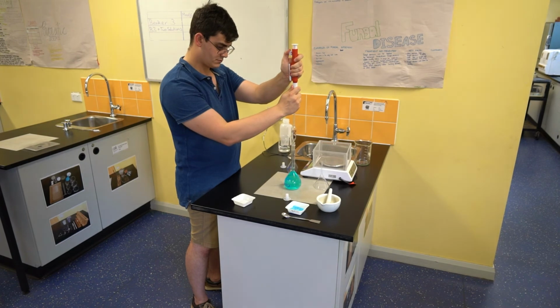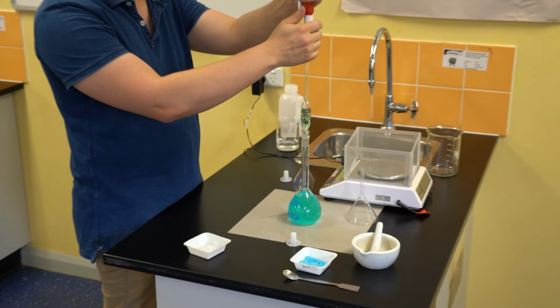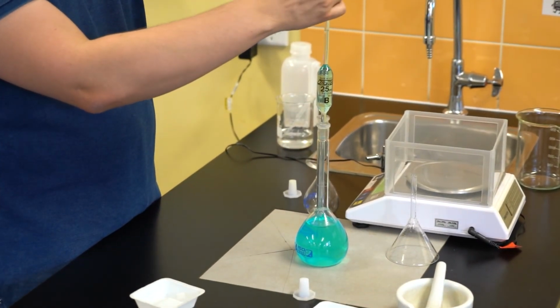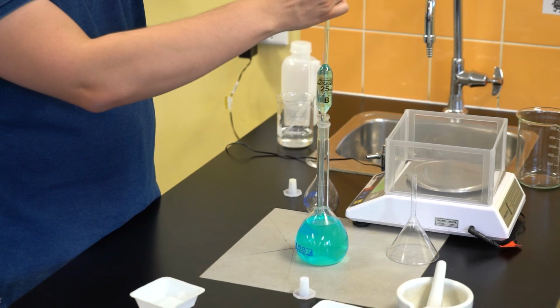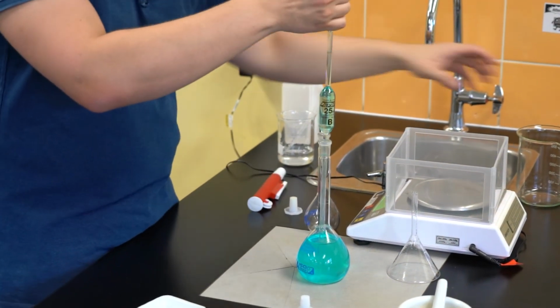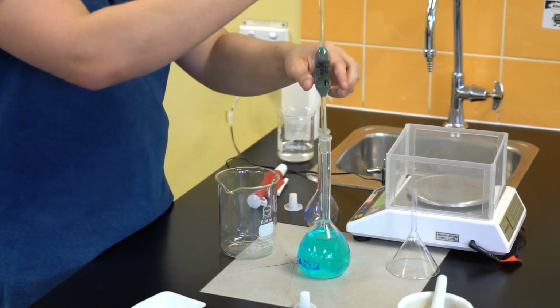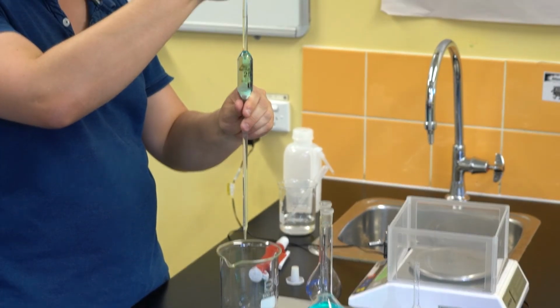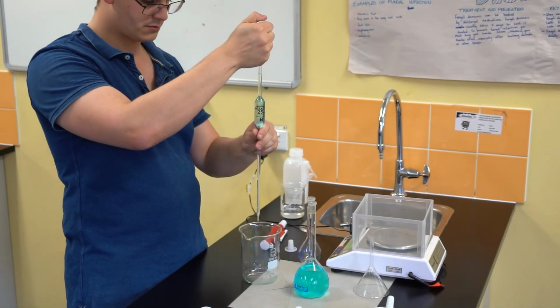We can then go and actually fill the pipette now that it is rinsed. I'm going to put it back into the first solution, attach my pipette filler, and draw up the liquid into the bulb, and then past the graduation mark, which is on the top end of the pipette. I'm then going to remove the pipette filler and hold it with my thumb, creating a seal just like you can at the top of a straw, and hold the liquid in place. I'm then going to move the pipette over to my waste beaker and begin to release some of the excess liquid which is sitting above the graduation mark.